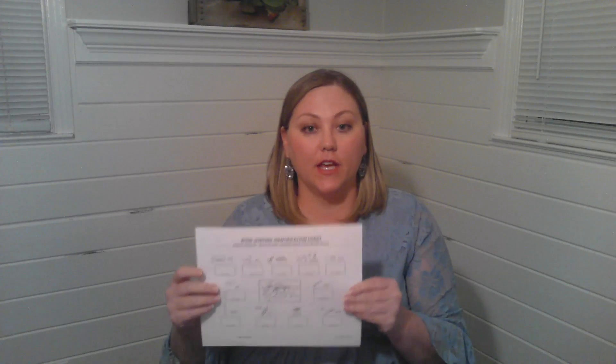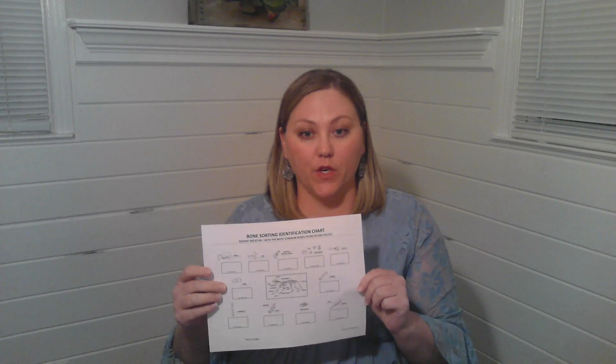For this experiment you will need an owl pellet per student. Each student in our community will have their own. You will need tweezers, a tray, gloves, and then will also need their pencil, and then whatever bone sorting sheet that you have chosen for your community.